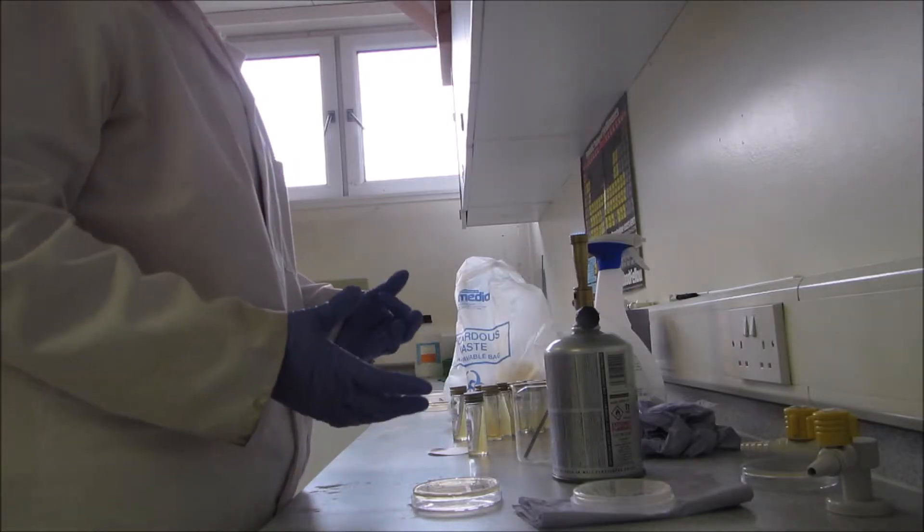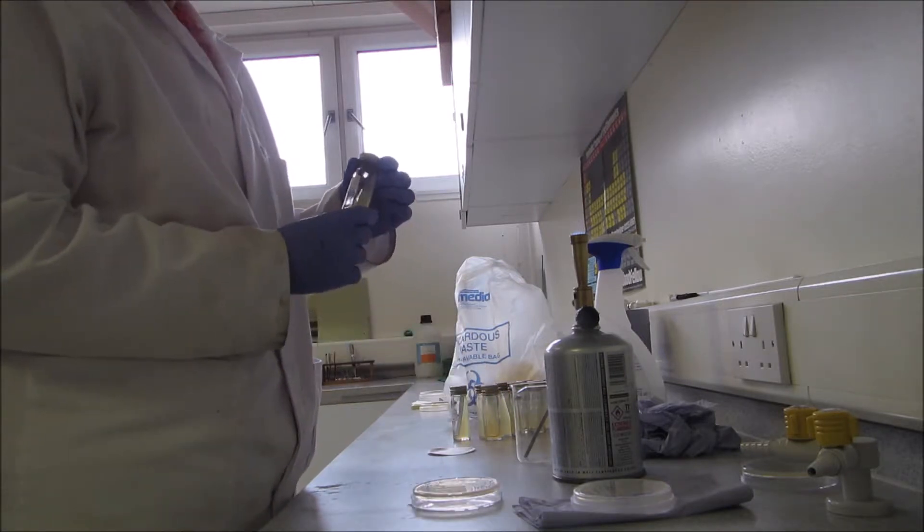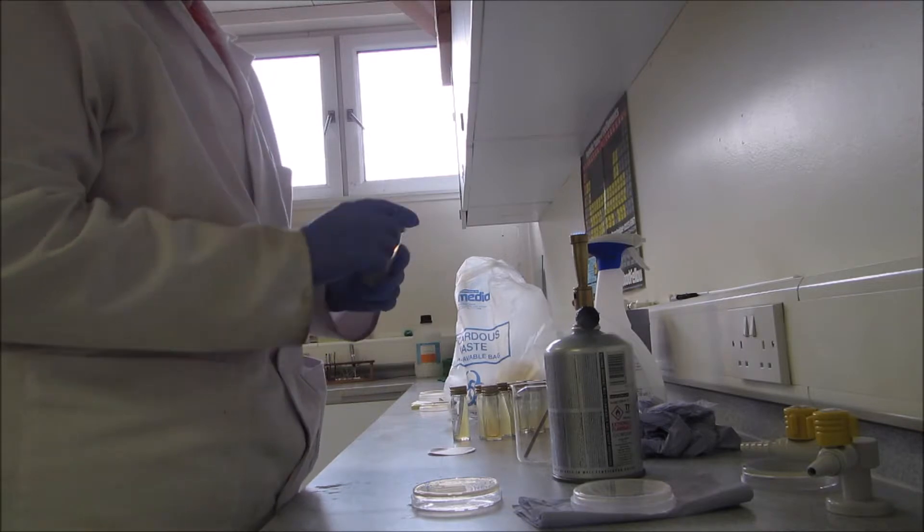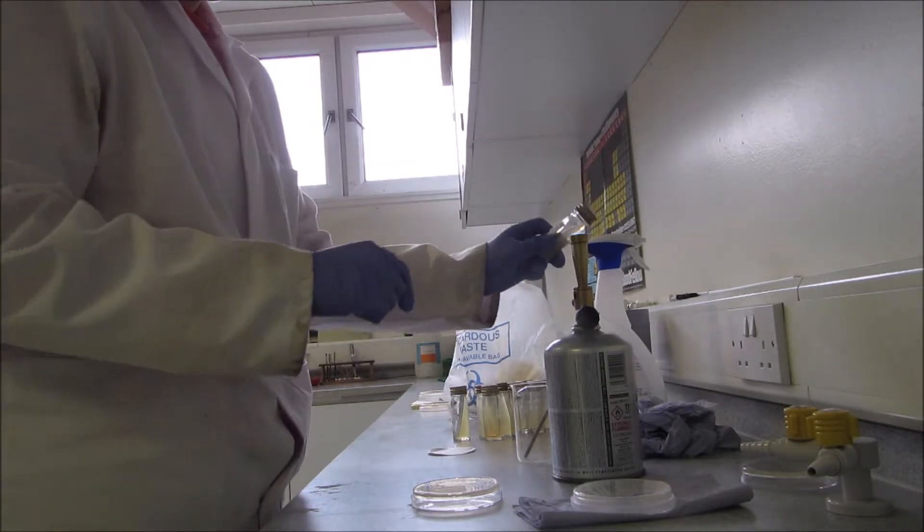So in addition to an agar streak plate, you might also be asked to do a slant or slope culture. So again, I've got a label on and I'll just flame the lid to open it, flame it again.